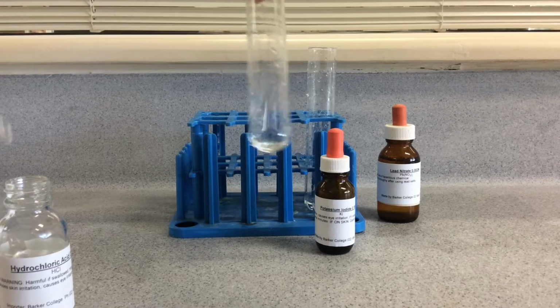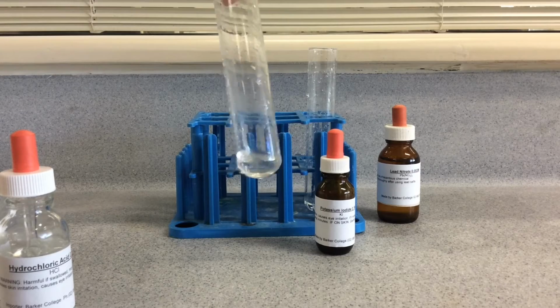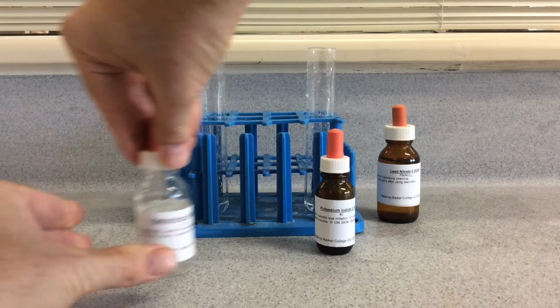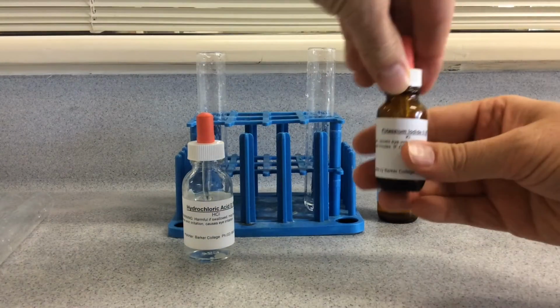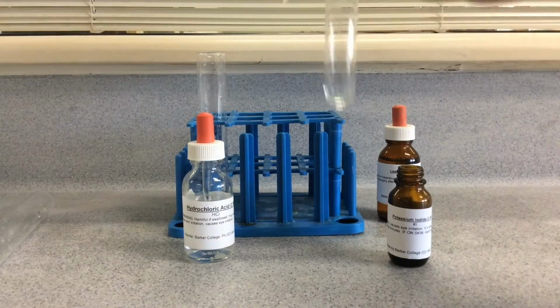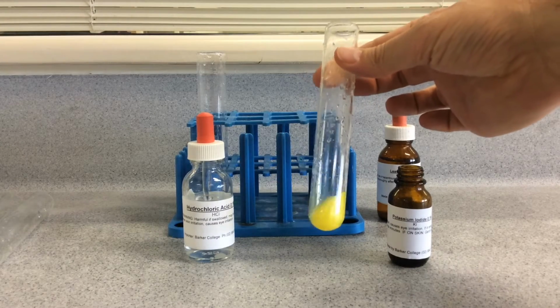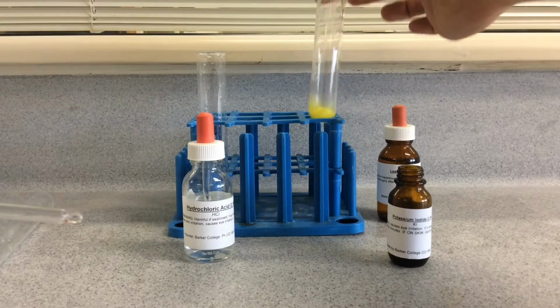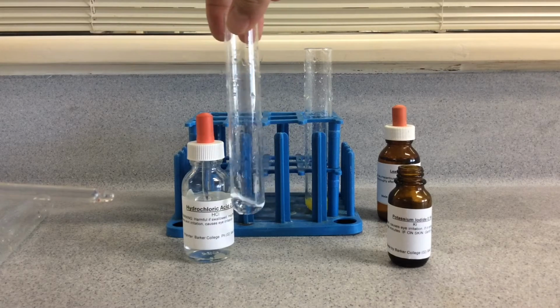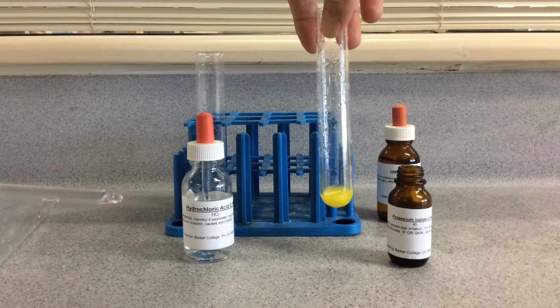Now the problem with this test is if the lead concentration isn't high enough, you won't get a precipitate. So one of the confirmation tests you can actually do is to try potassium iodide, because lead and iodine will form a yellow precipitate at a lower concentration of lead. So if we try this one, we get the characteristic yellow precipitate of lead iodide. So that's the confirmation test. So just remember, with lead, if your concentration is insufficient, you may not get a precipitate with the chloride ions. You'll need to do the confirmation test of iodide ions with the lead.